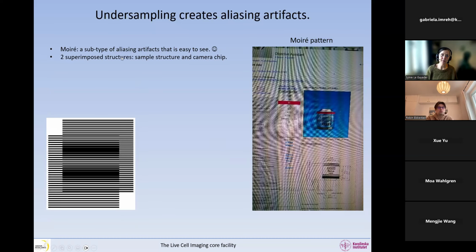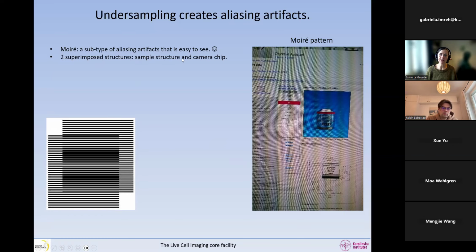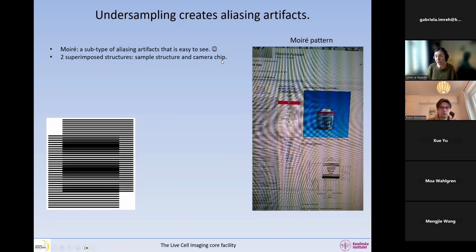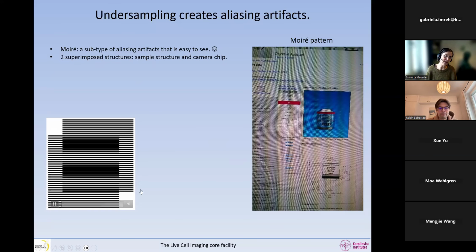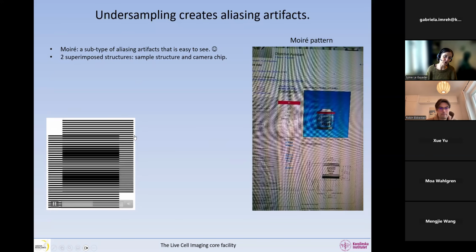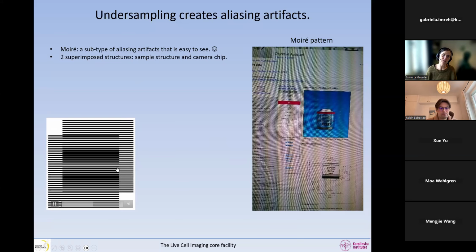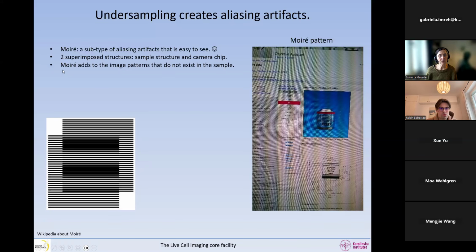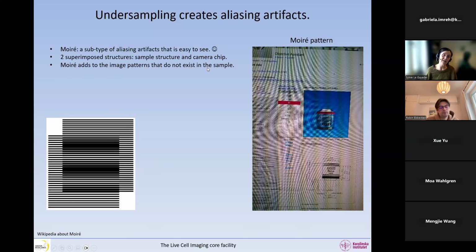This happens, moire patterns happen when we have two superimposed structures. So in our case, we have a structure in the sample, and we have the camera chip, which is structured, it has a grid. So what you can see in here, if you superimpose two structures, is that you get these thick black lines that are created and do not exist in the sample. And so the moire adds to the image some patterns that do not exist in the sample.